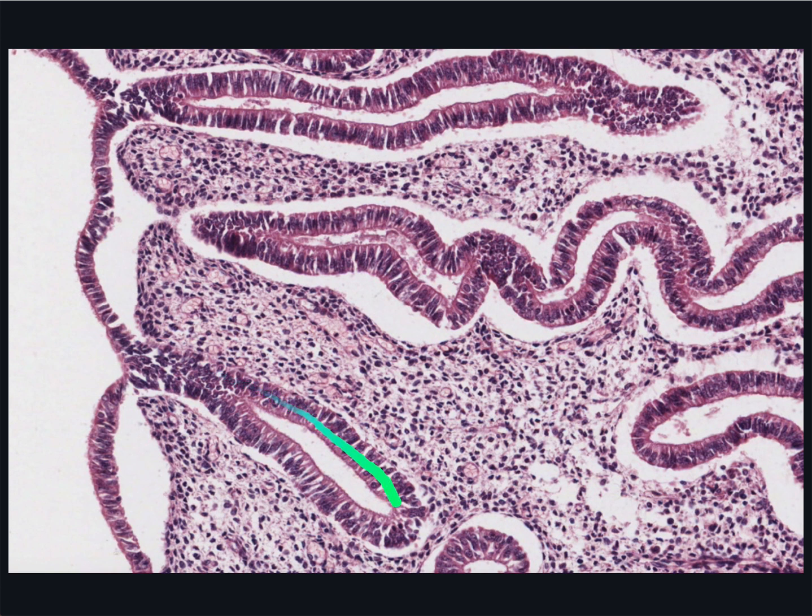Look carefully and note there are remnants of the epithelium along the endometrial surface. It's similar to the epithelium of the glands. This is not surprising because the surface epithelium does come from the glands. After the functional layer of the endometrium is shed during menstruation, the surface is bare connective tissue.